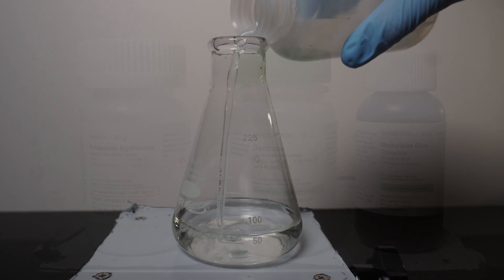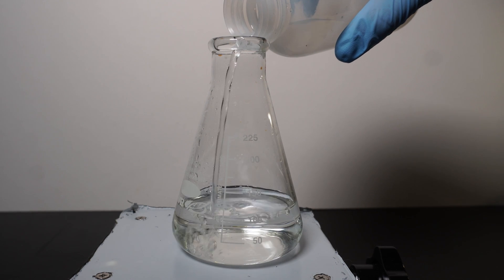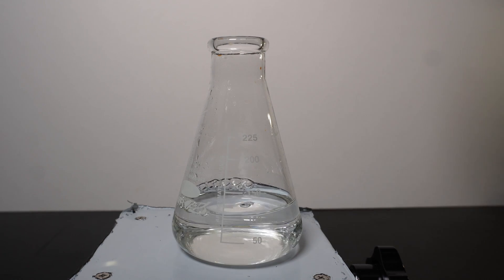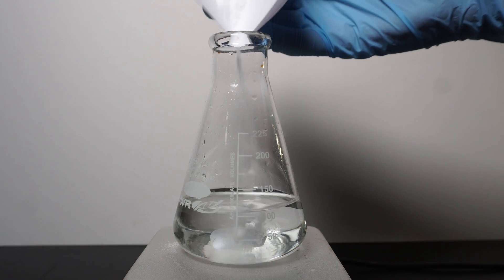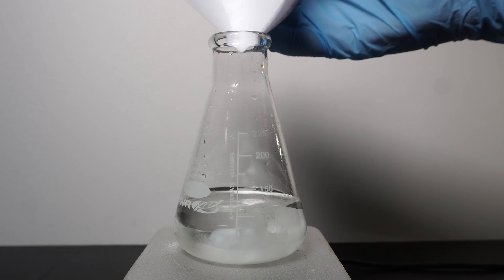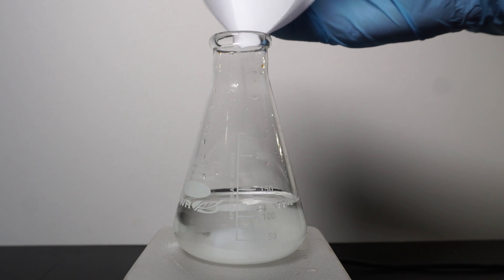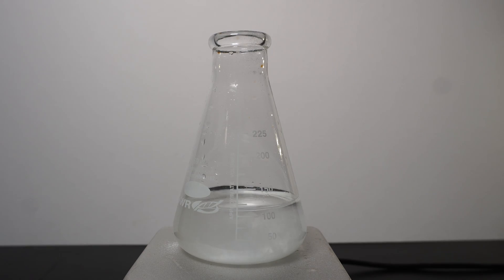Anyway, let's get started. The first thing we'll do is add about 125ml of water into an Erlenmeyer flask. Next I drop in a stir bar and add in 5 grams of dextrose. Dextrose is really soluble in water, however, you want to make sure all of it dissolves so I turn on stirring and it dissolves almost immediately.